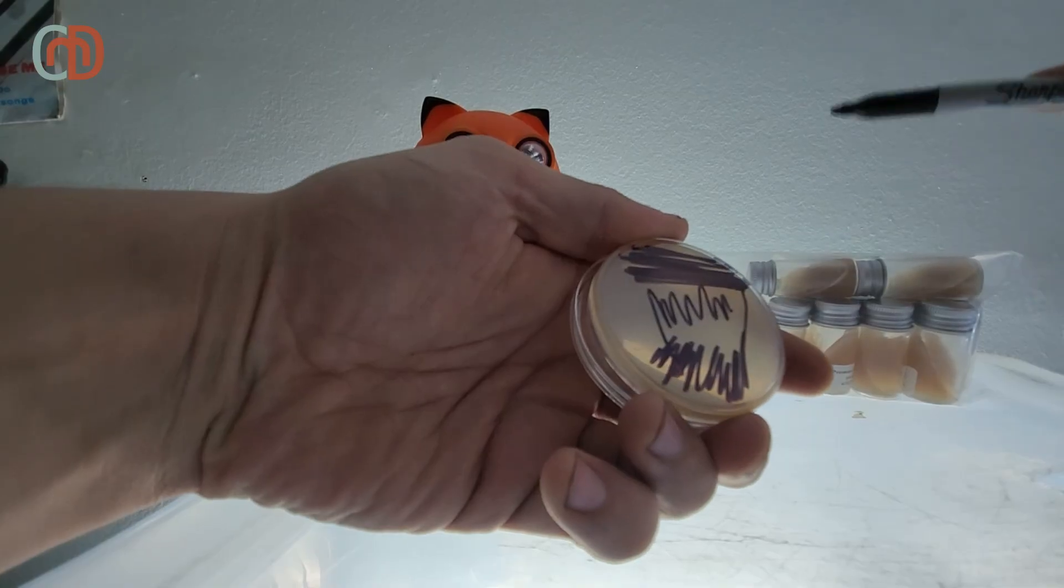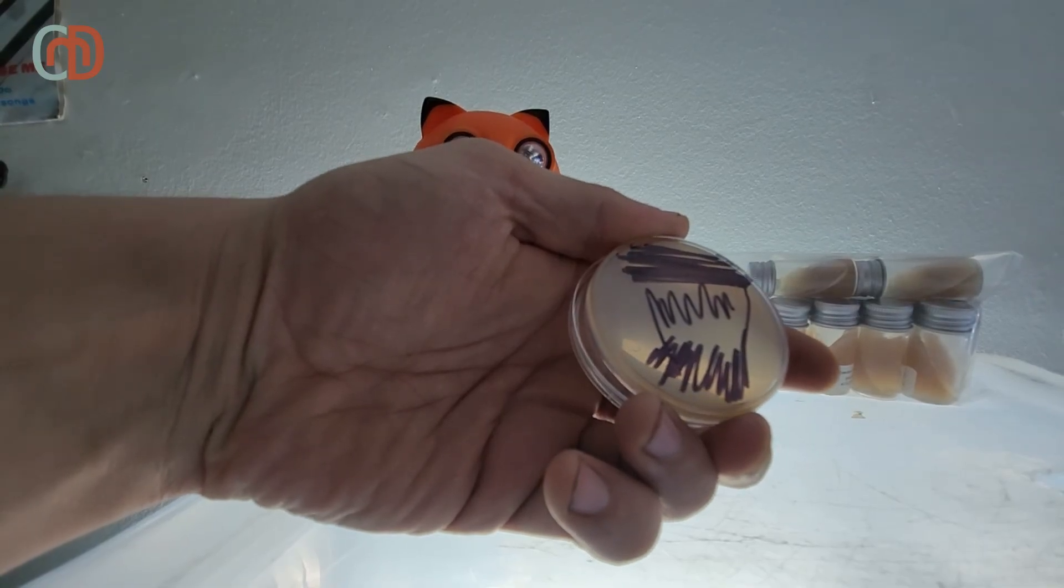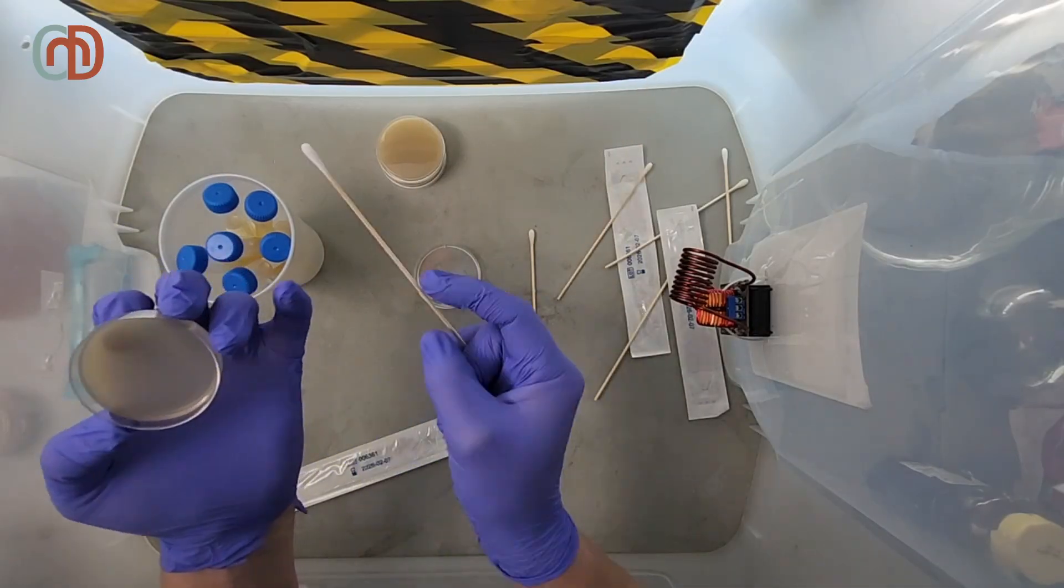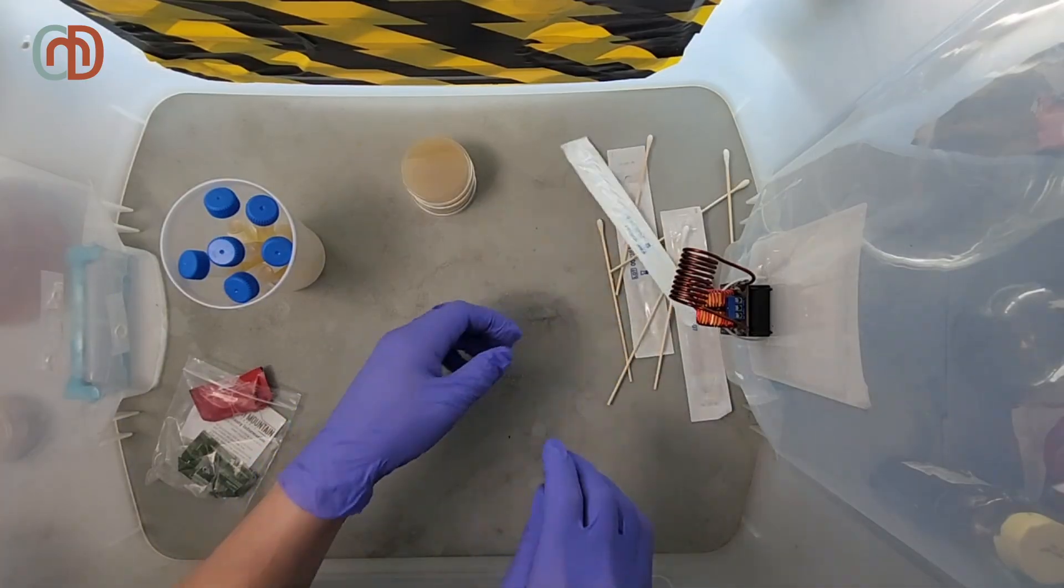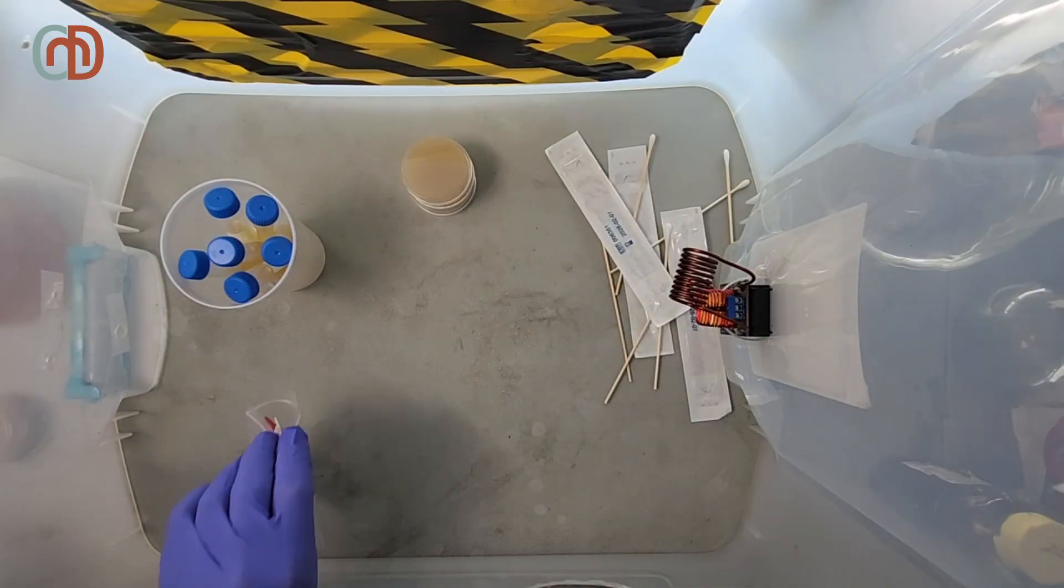I finish streaking the last plate, just so I have a big selection to choose from. Then we have to wait about 24 hours for the cell cultures to show up.